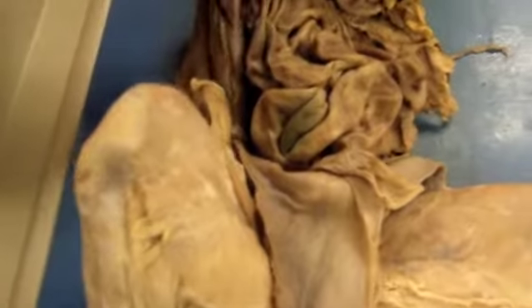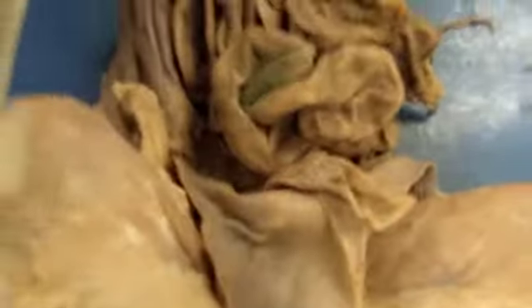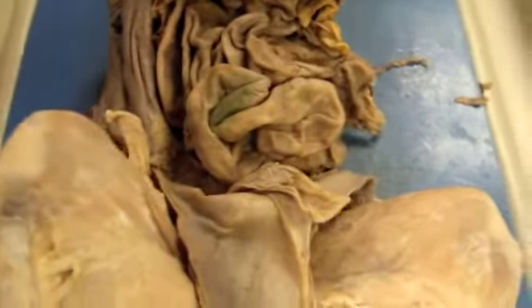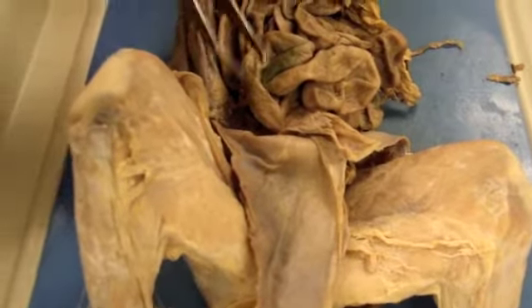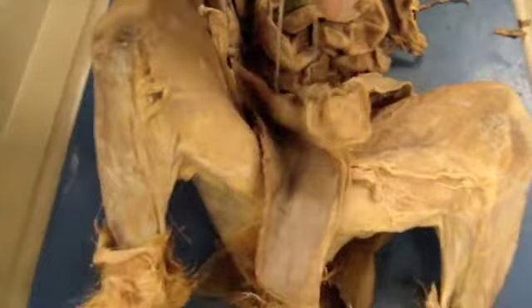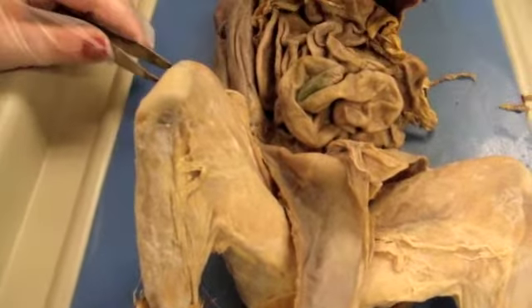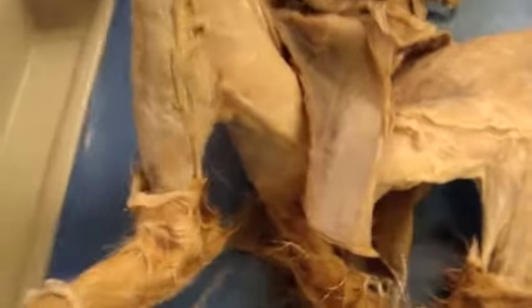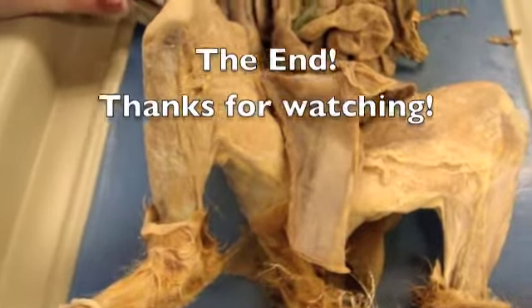And also the large intestine. This is a tube that frames the small intestine, and it is the site of absorption of water, salts, minerals, and vitamins, and it's also where elimination takes place once the feces is made, after everything is absorbed. It then moves to the rectum and is excreted through the anus. And that is all for our inside of the cat.